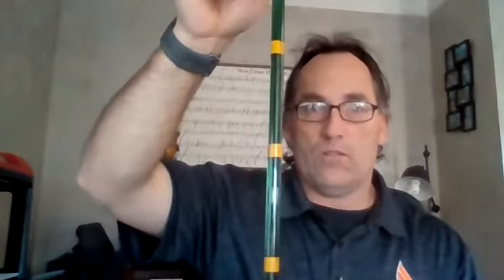So let's do the same thing for the other 2 tubes, for the blue and the green. So let's do green next. It's next on our data table. So here we go. Let's do the green one. We'll invert it. Start the timer. Bubble's traveling much slower than the previous one did. Almost to the top. 19.2 seconds there. And our last one, the blue, here we go.